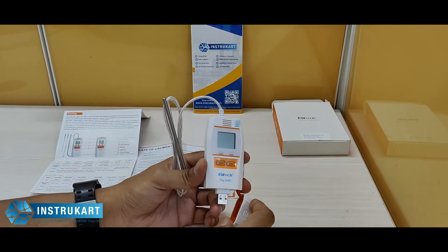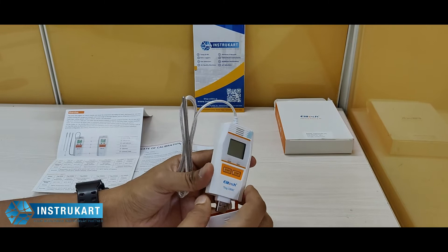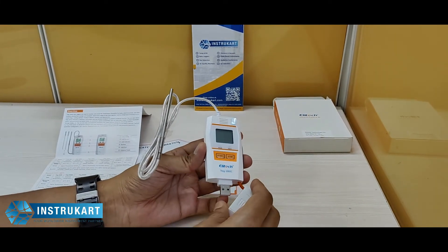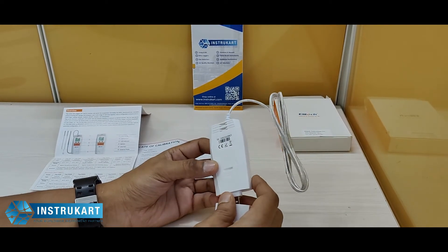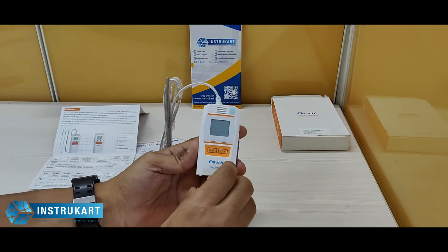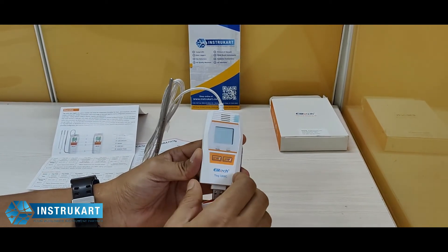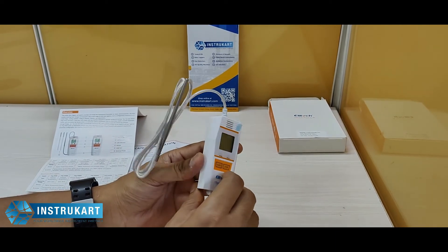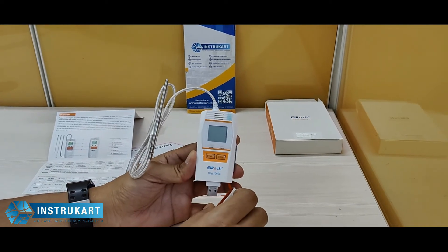It also measures humidity with an accuracy of plus or minus 3 percent RH. It has memory inside, which means you can connect it later to a PC and retrieve the data, just like other USB data loggers. Being a multi-use data logger, you can put it in a cyclic mode or a stop mode, and it can also be controlled through the PC.